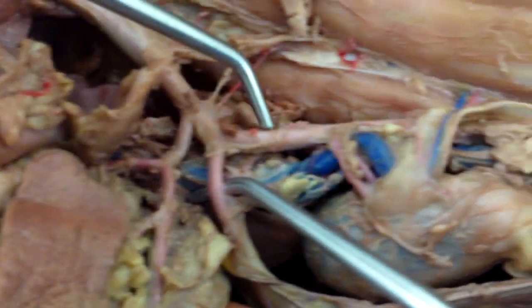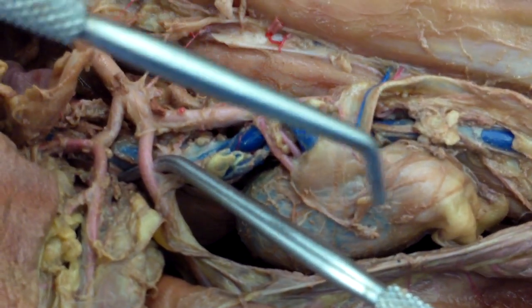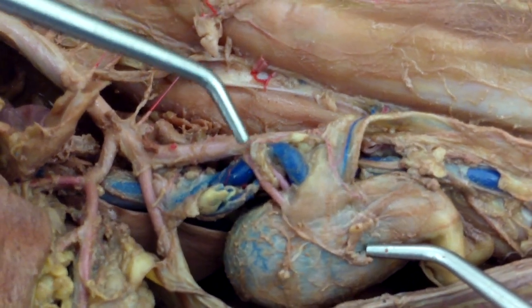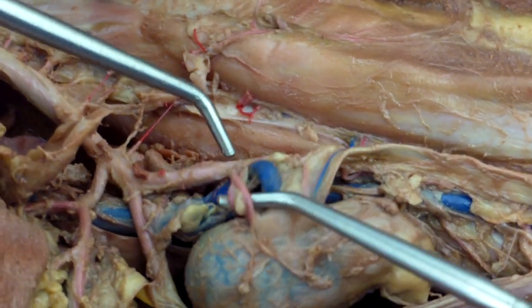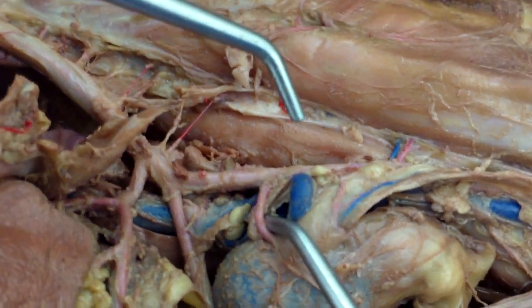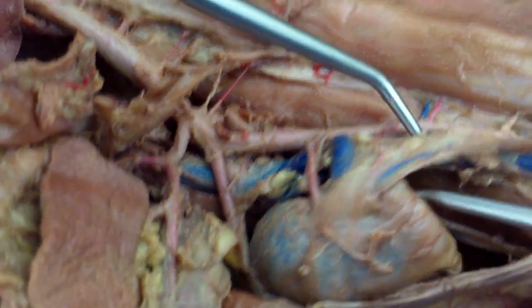Going down, continuing down, you have your kidneys — so going to the kidneys, that's your renal, right there. And for females you would have your ovarian, but we have a male.